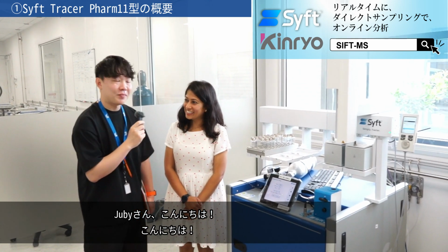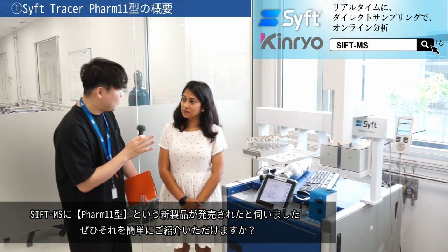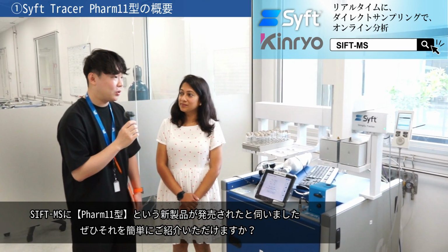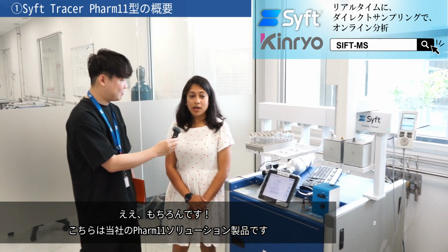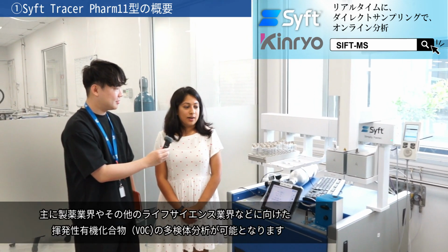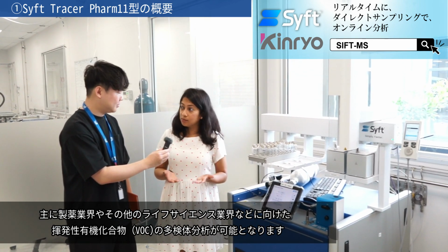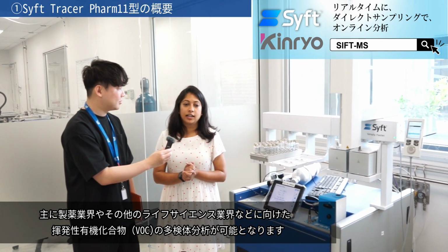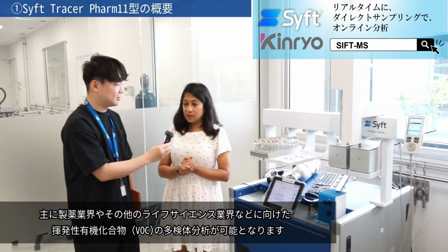Hello. How are you? So we know we have the Pharm11 as a new product. So could you give a quick introduction for us? Yeah, absolutely. So this is Syft's Pharm11 solution product. It provides multi-analyte volatile organic compound analysis for industries like pharmaceuticals and other life science industries.